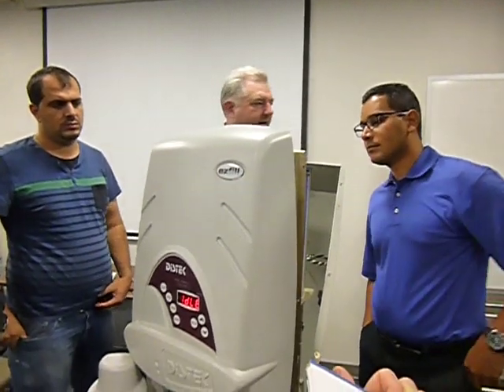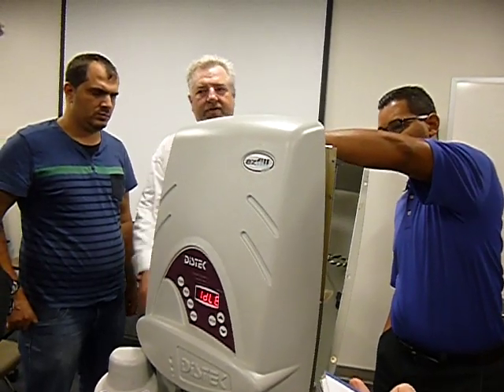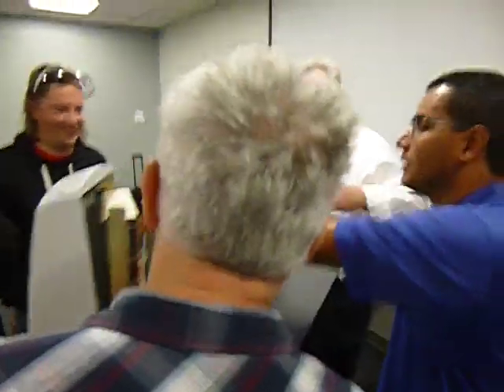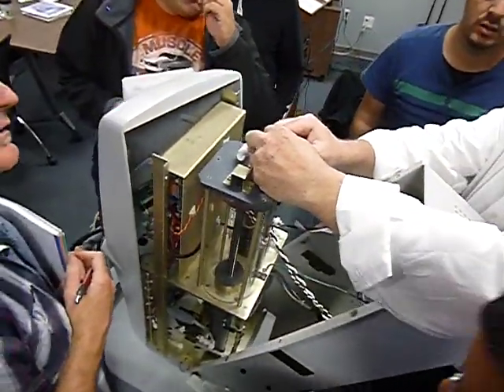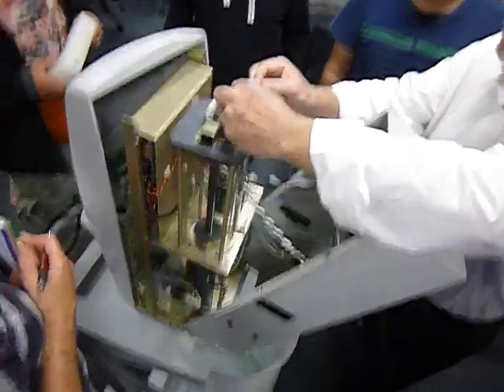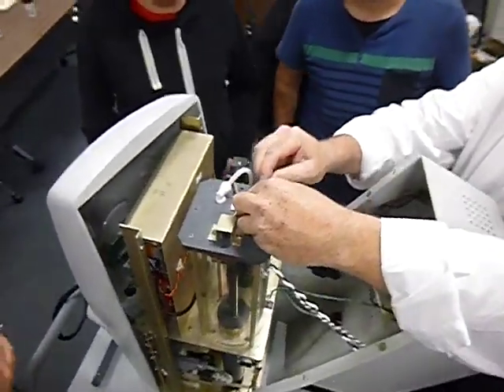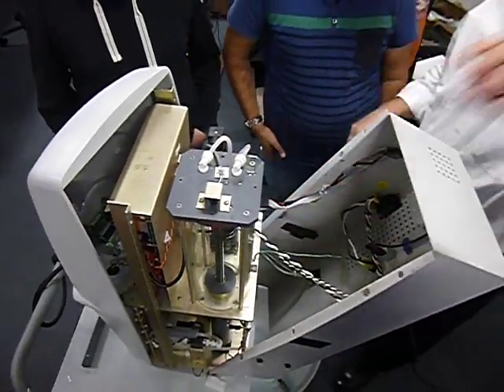Yep, you got all those fittings there, right? Now, what happens if you have to replace this tubing? How do you get this tubing out? You take it out from your place, that's it. It's fast. I knew somebody who just broke one of these because they didn't know how to. You just press this in, and just press that center pin in and pull it out, and you're good to go.